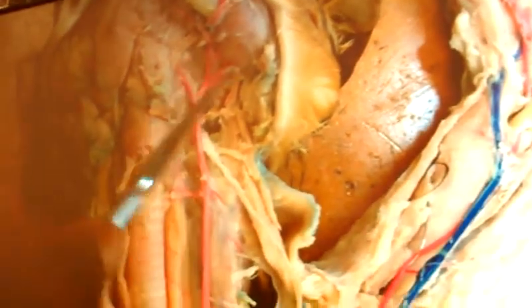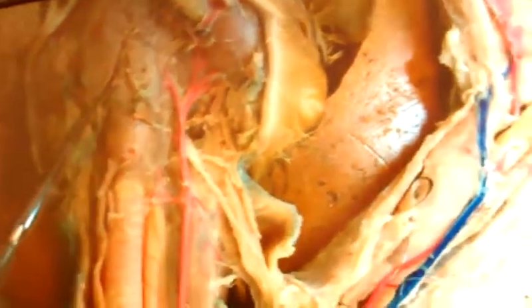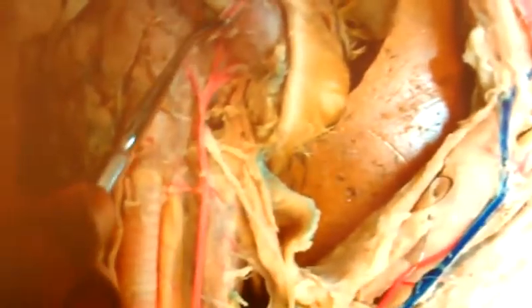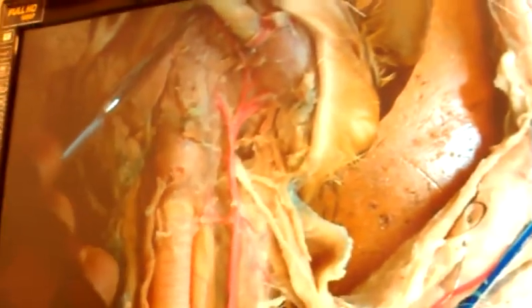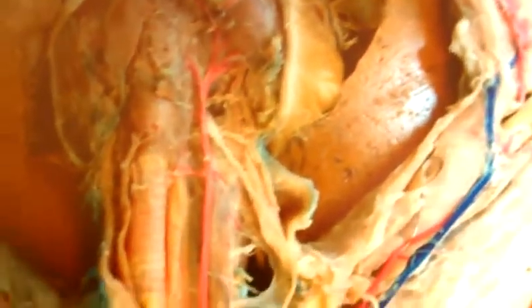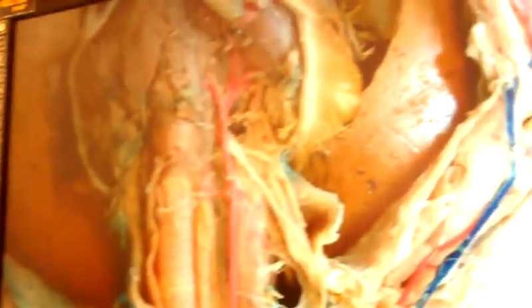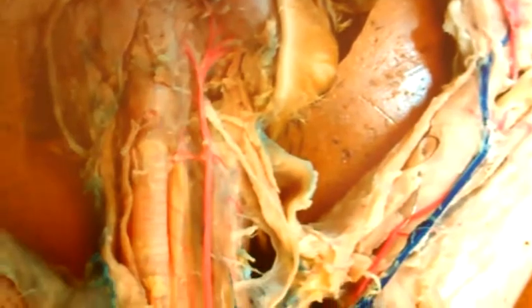Now, we got this external maxillary that wants to go up, Mr. Gilmore, but there's a branch that comes off right in front of the masseter. His name is labial. If he's labial, Mr. Gilmore, what are you going to call this fella that's going underneath the mandible? Submental. Meaning, tell me, Mr. Gilmore, we got all the vessels, arterial supply going to the arm and to the head? Yes. Now, guess what? We're stopping. Take a break.